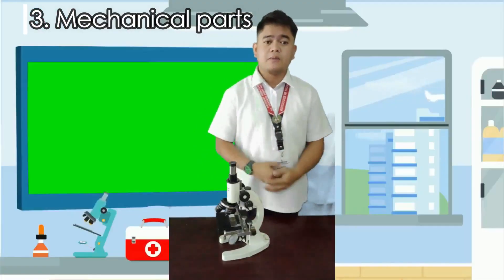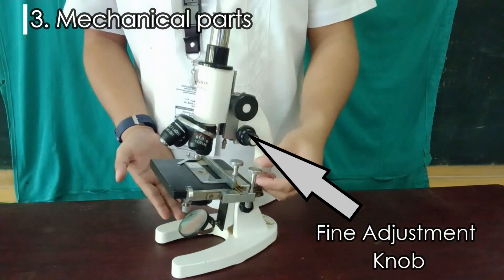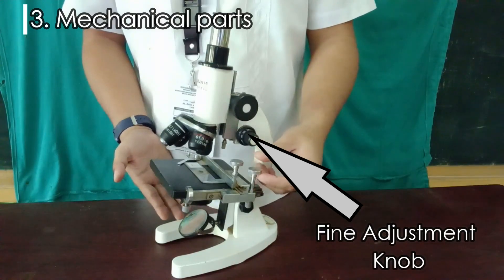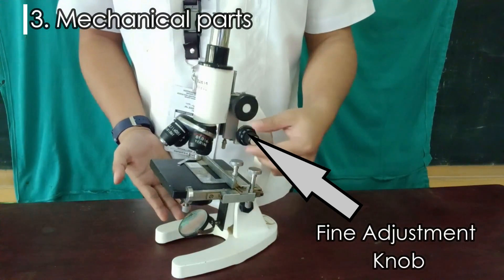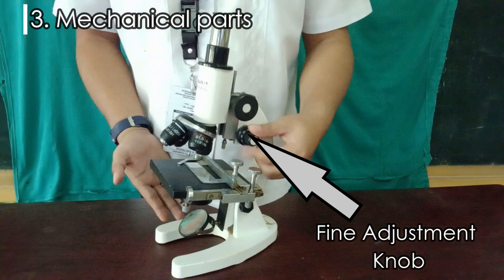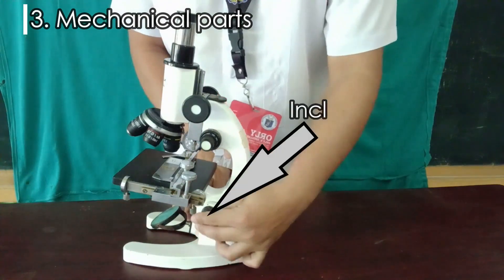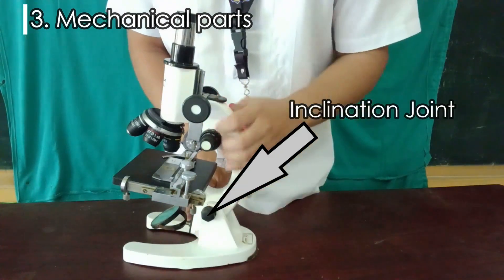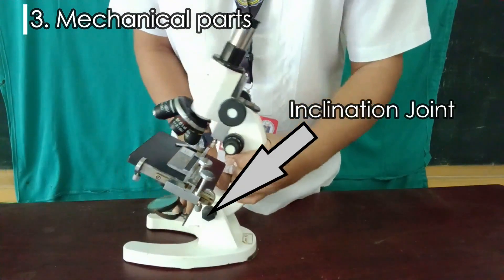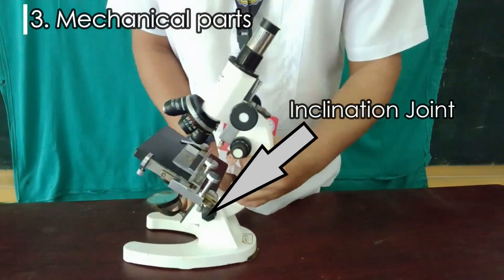The fine adjustment knob is used to bring the specimen into sharp focus under low power and is used for all focusing when using high power lenses. The inclination joint connects the arm to the base and helps incline the microscope for a more comfortable view.